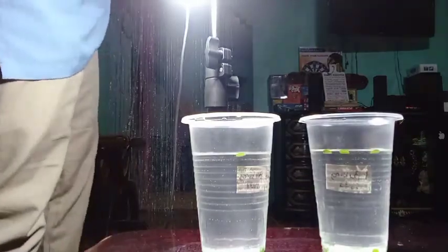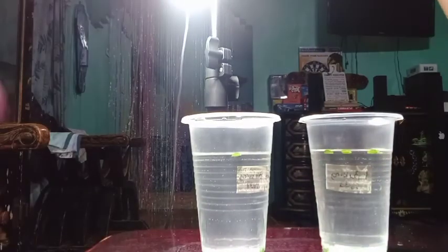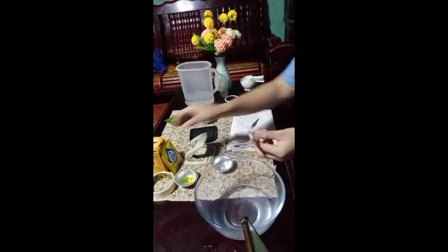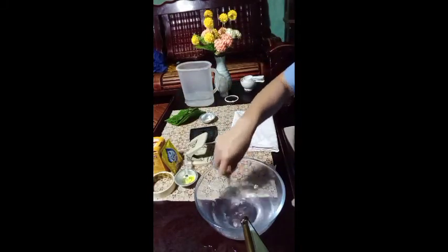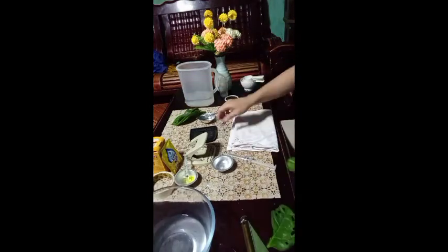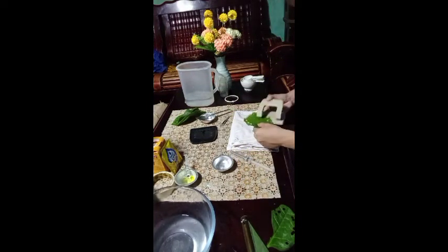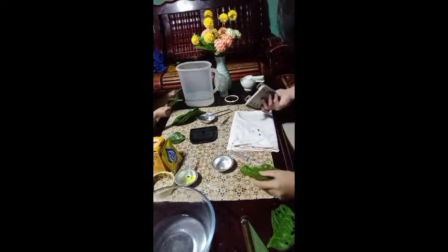So after several minutes, it looks like most of the leaf discs in the light were floating. So, to a negative baking soda cup, add 300 ml water and 1 drop of dishwashing liquid. Stir until it dissolves in the water. Avoid creating foam. In this setup, repeat the same procedure.